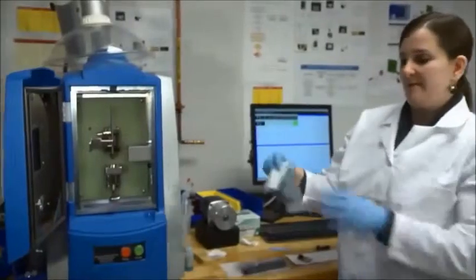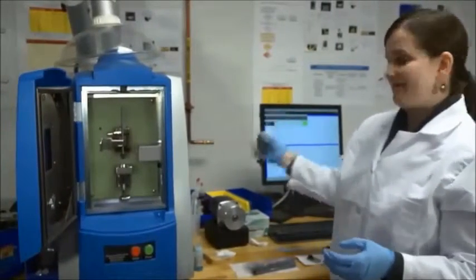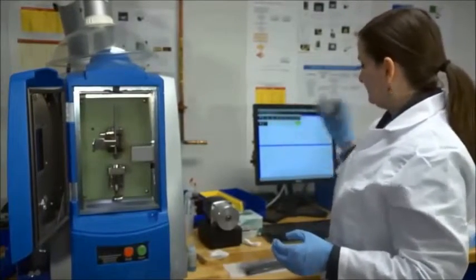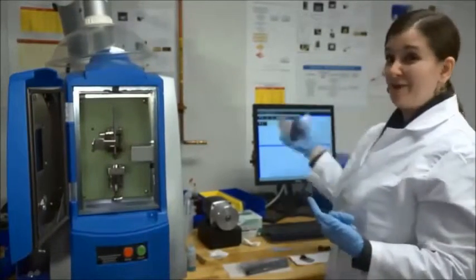I'm going to take my oil sample and shake it vigorously. You want to do this for about 30 seconds.